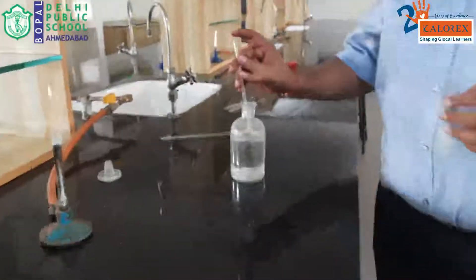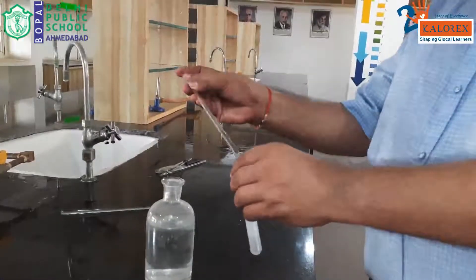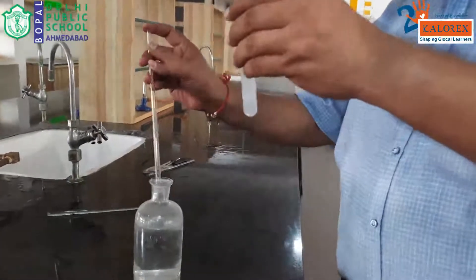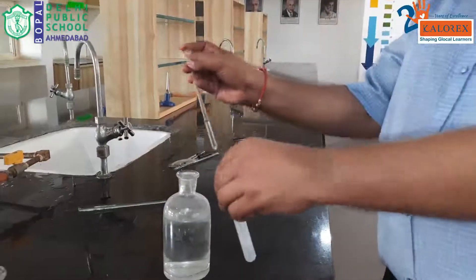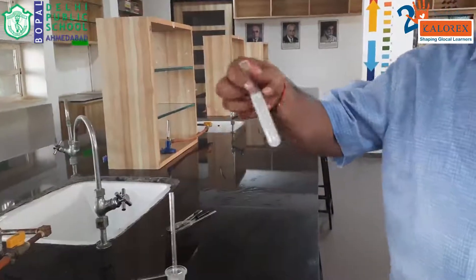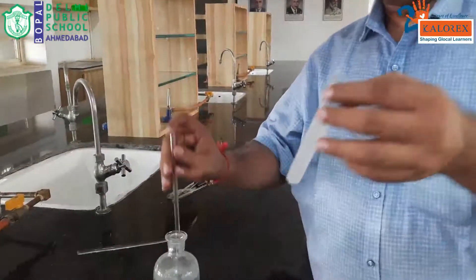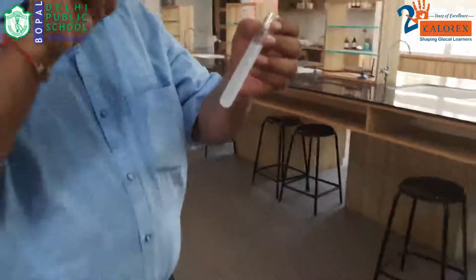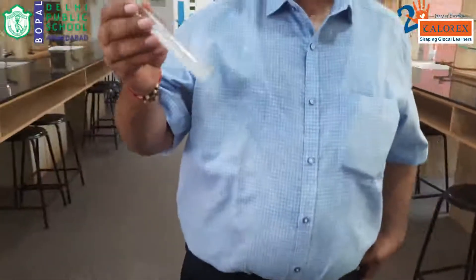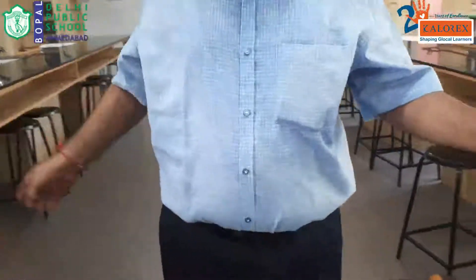One more thing to check: what happens when we add ammonium hydroxide to these precipitates? Adding ammonium hydroxide to the silver chloride precipitate — most of the precipitates dissolve. Silver chloride forms a complex with ammonia, [Ag(NH₃)₂]⁺, and the precipitate dissolves. So silver chloride precipitates formed by adding AgNO₃ get dissolved by adding ammonium hydroxide. This once again confirms Cl⁻.